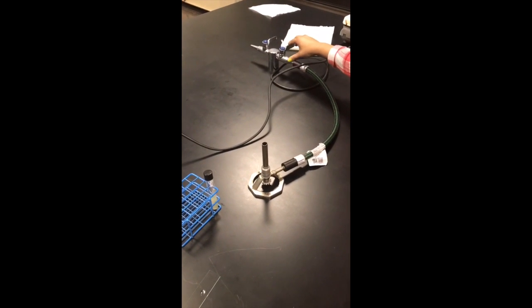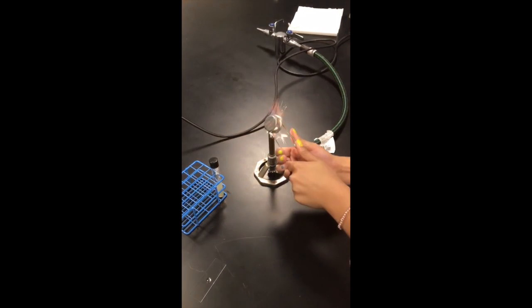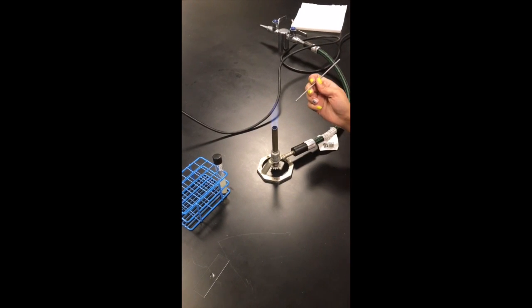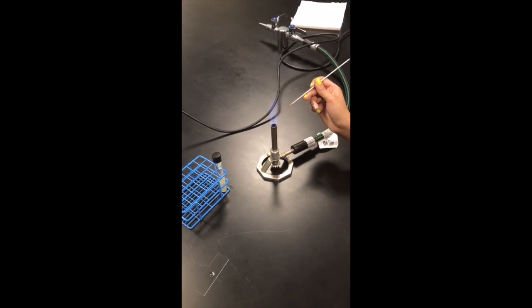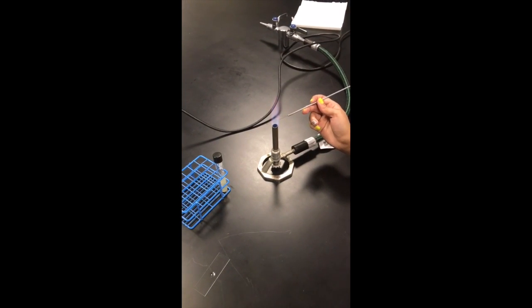Then we're going to light the Bunsen burner. If you don't know how to do this, you should check out another one of our videos that will demonstrate how to do that. Now we're going to take our inoculating loop and flame it to get it sterilized. It's going to show an orange-red color, and that means you're doing it correctly.